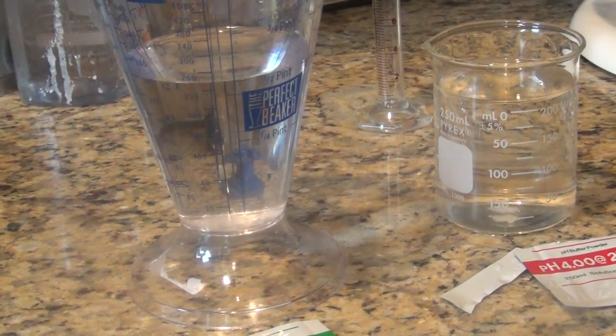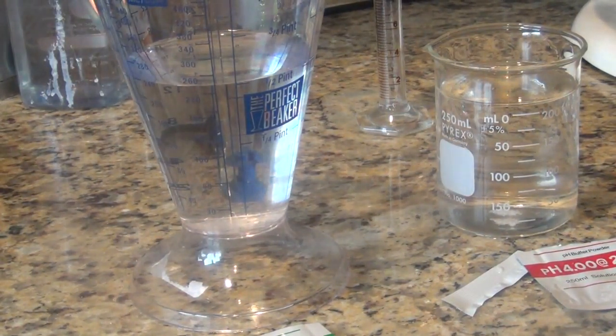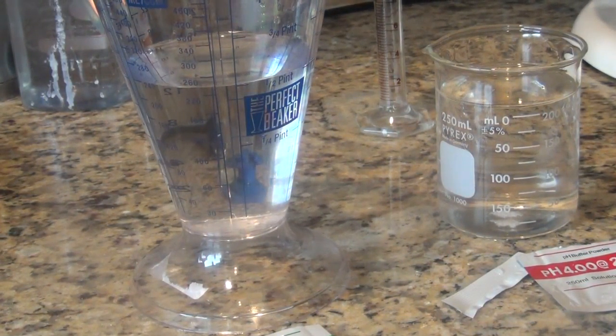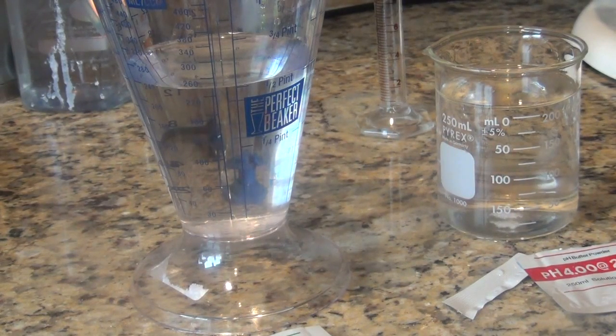This is how we calibrate a pH meter. I had the pH meter sitting in distilled water for 10 minutes.